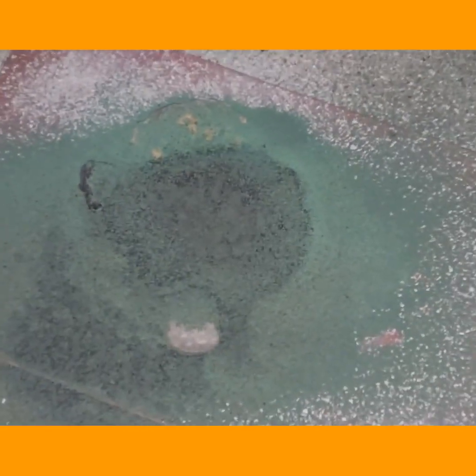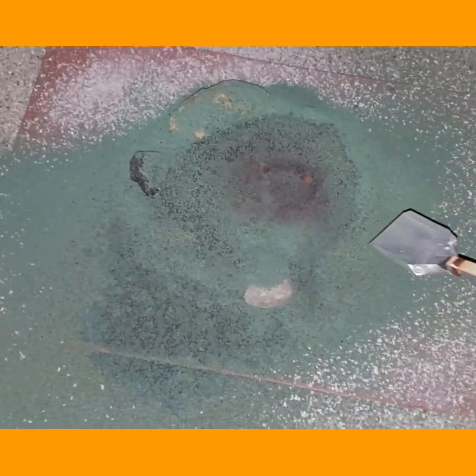You can clearly see that the chromium oxide formed with the sugar is darker than the previous burn. About 10 minutes later, after it finished burning and I went to clean up the mess so I could test the next mix — and it is hot down there.